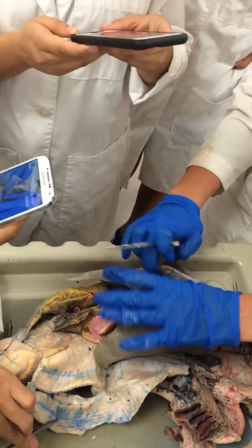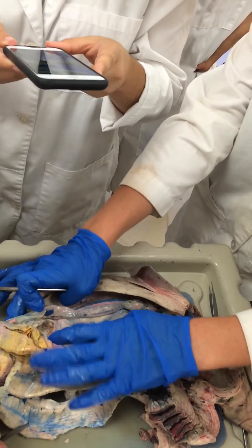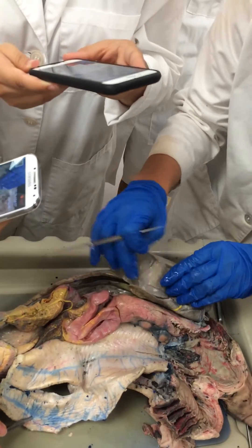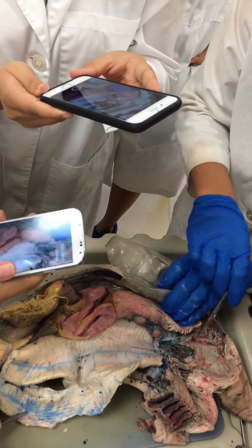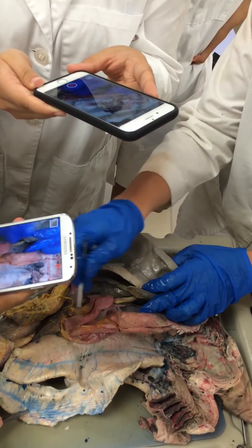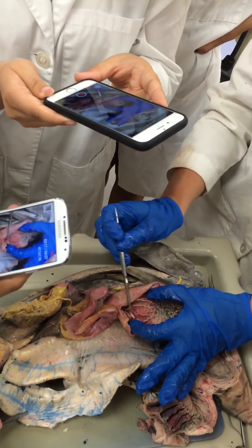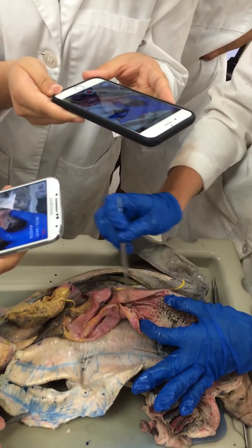There's a left and a right side. You can see the right side over here — here's the ovary with the eggs, here's the oviduct, and then the uterine horn on this side. Pulling over the left lobe of the liver, we can see into the esophagus. From the pharynx it transitions into the esophagus, and then this part would be the J-shaped stomach. As we open that up, we have the papillae of the esophagus, and then once it starts to be rugae, that's the stomach. So esophagus up here with papillae, and stomach down here with rugae.